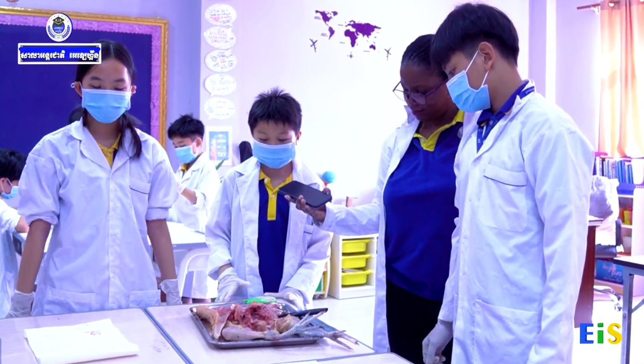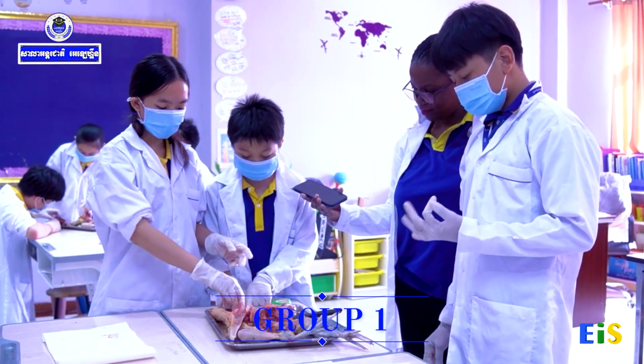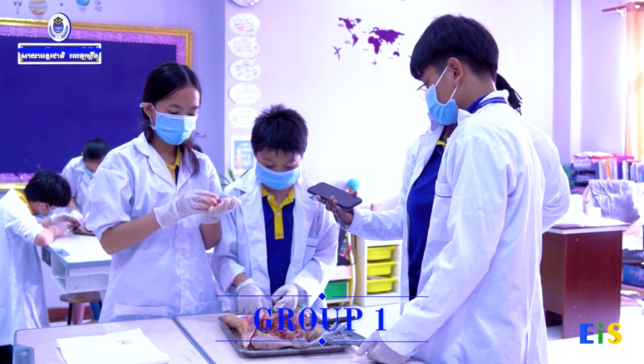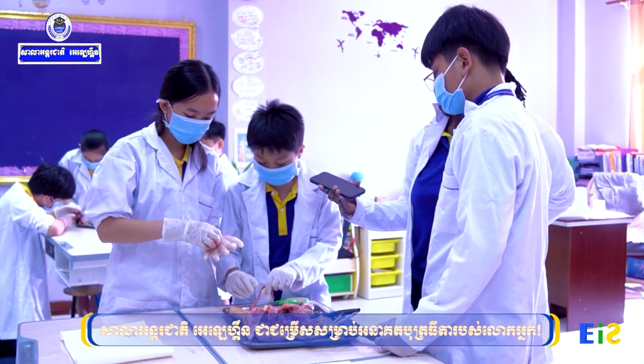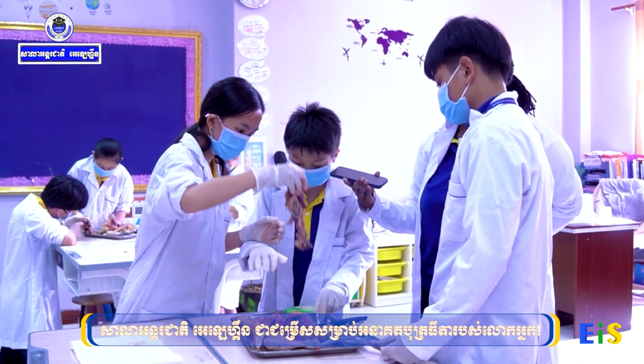My name is Chentayo, and today we're dissecting a chicken. So these two parts are the lungs. They are red right here, and this is the throat. And bring the whole thing.